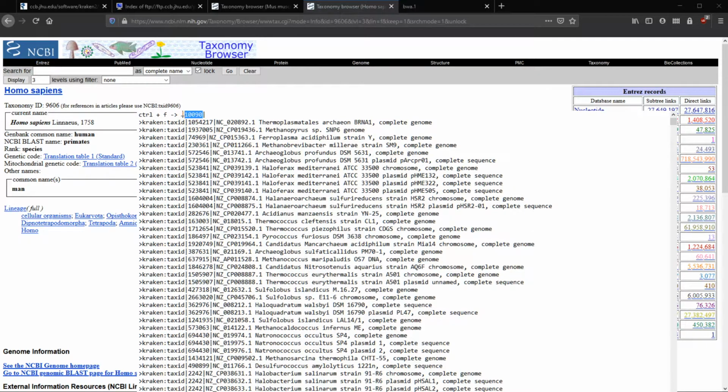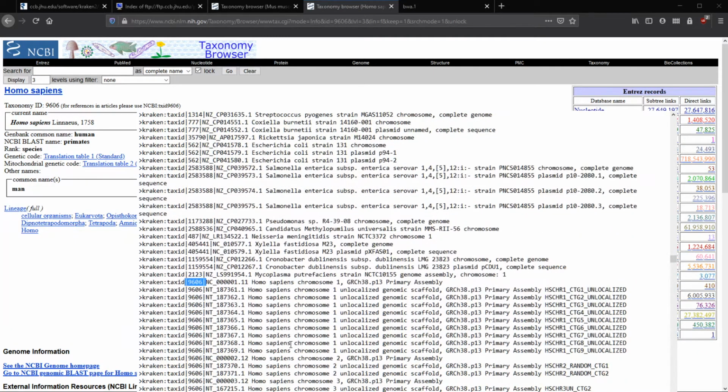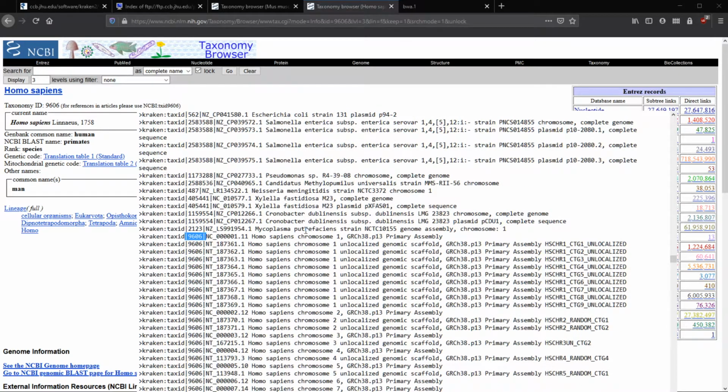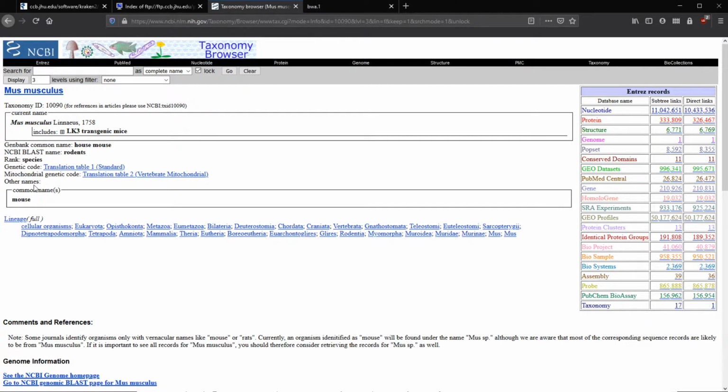So if we go back to our Notepad, instead of this, we can search 9606. Let's see if it comes up with any. Okay, good. So we'll have all of our human chromosomes included in this. So then we can check whether or not there's human contamination of the mRNA reads. Great. Firefox. Let's close the human one.